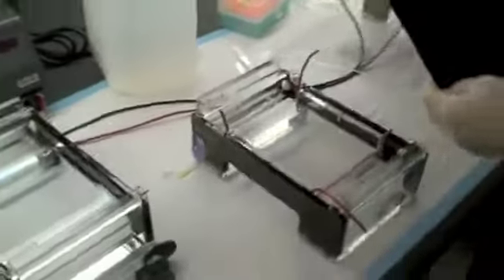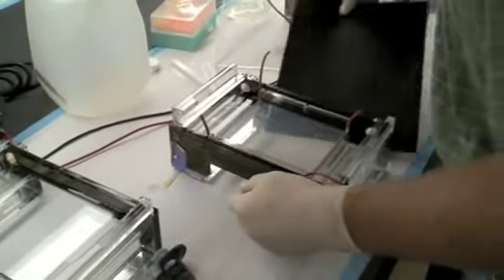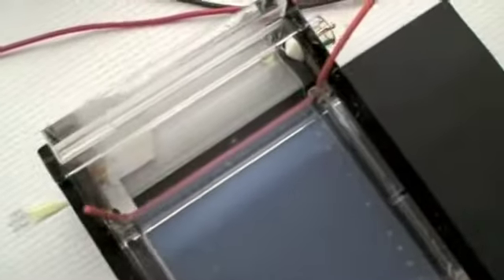It's hard to see those wells, and it helps me load the gel to add a background contrast to that. Now look and see, can you see the wells now? It's pretty obvious, so that helps with loading.